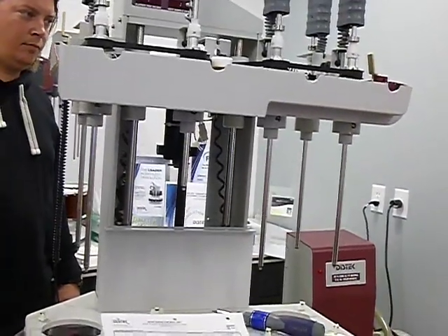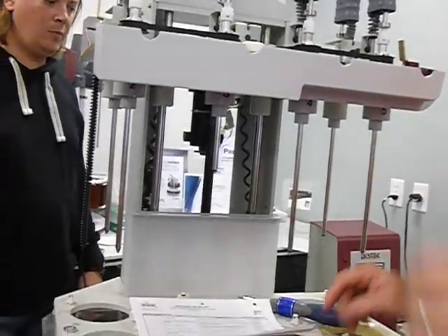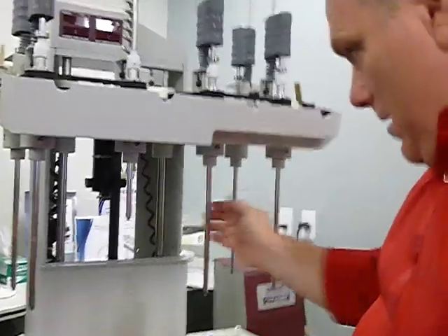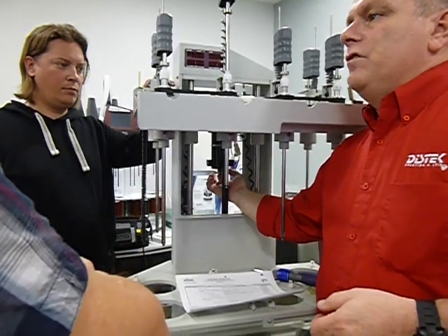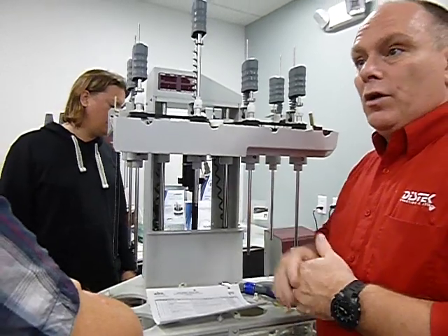If you have to adjust the gap on it, I usually don't adjust it to a certain gap, even though it calls for an actual gap, so you get a feeler gauge out and actually adjust the gap on it, which would be the difference between the tip of this and the actual spinning portion of the motor down here. I usually will just loosen the nut on the back of this, and I'll start running it in and out until I get it to where it's working the way it's supposed to.